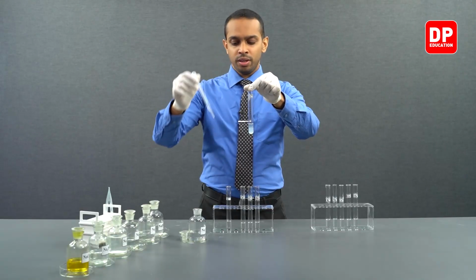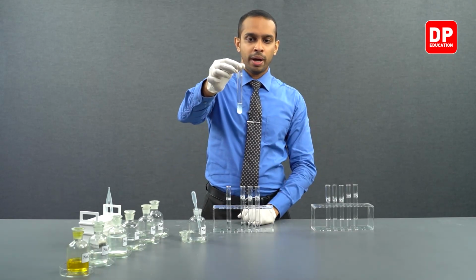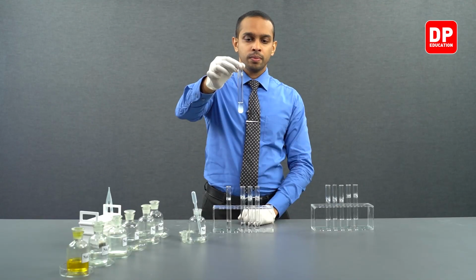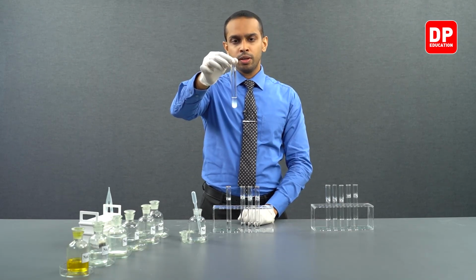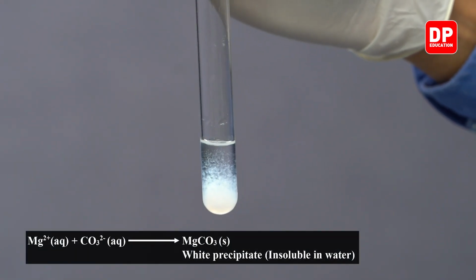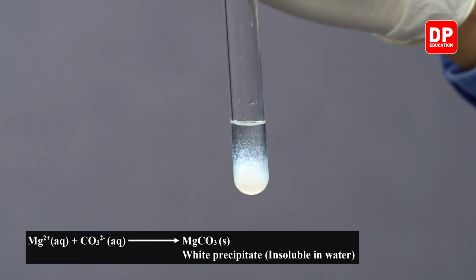Do you see? When I add sodium carbonate drop by drop to magnesium 2 plus aqueous solution, we formed a white color precipitate. So when magnesium 2 plus ions come into contact with carbonate ions, they form magnesium carbonate, which is a white color precipitate.